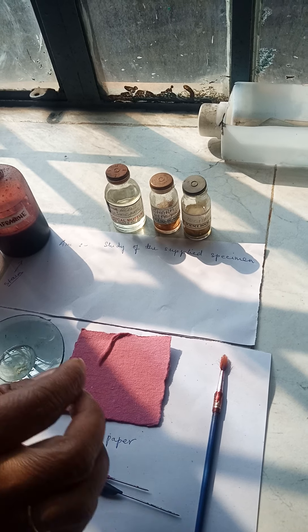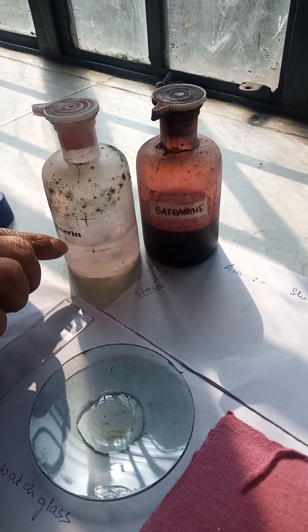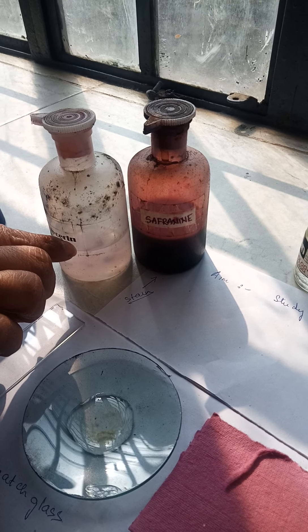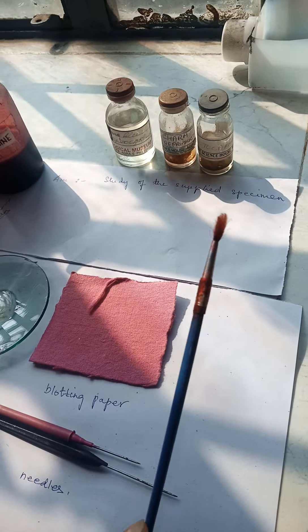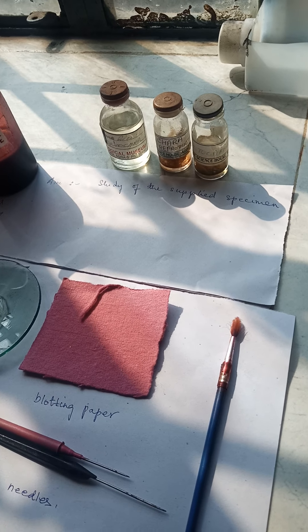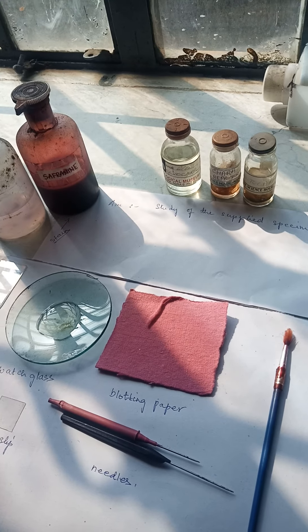You will also need a brush. You'll be needing this red-colored stain — this is safranin — and this transparent liquid, which is glycerin. These two have to be mixed and used in the experiment. That is why we need a brush: to dip the brush into the stain. You also need a blade for cutting the specimen.